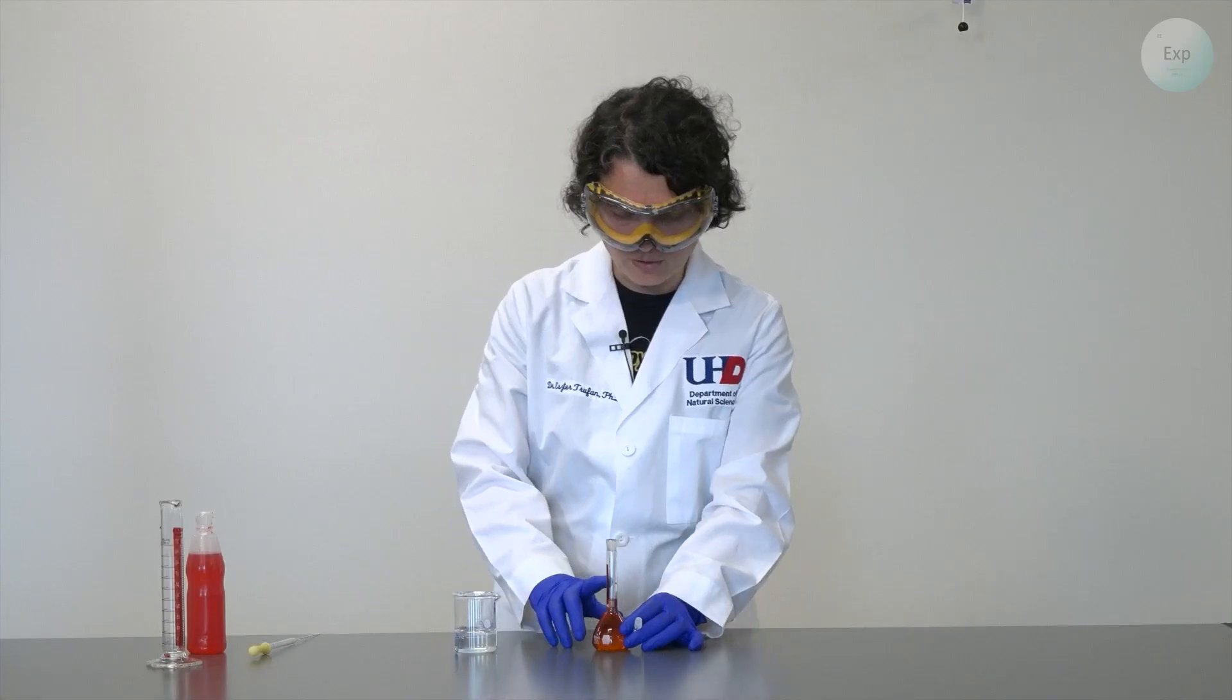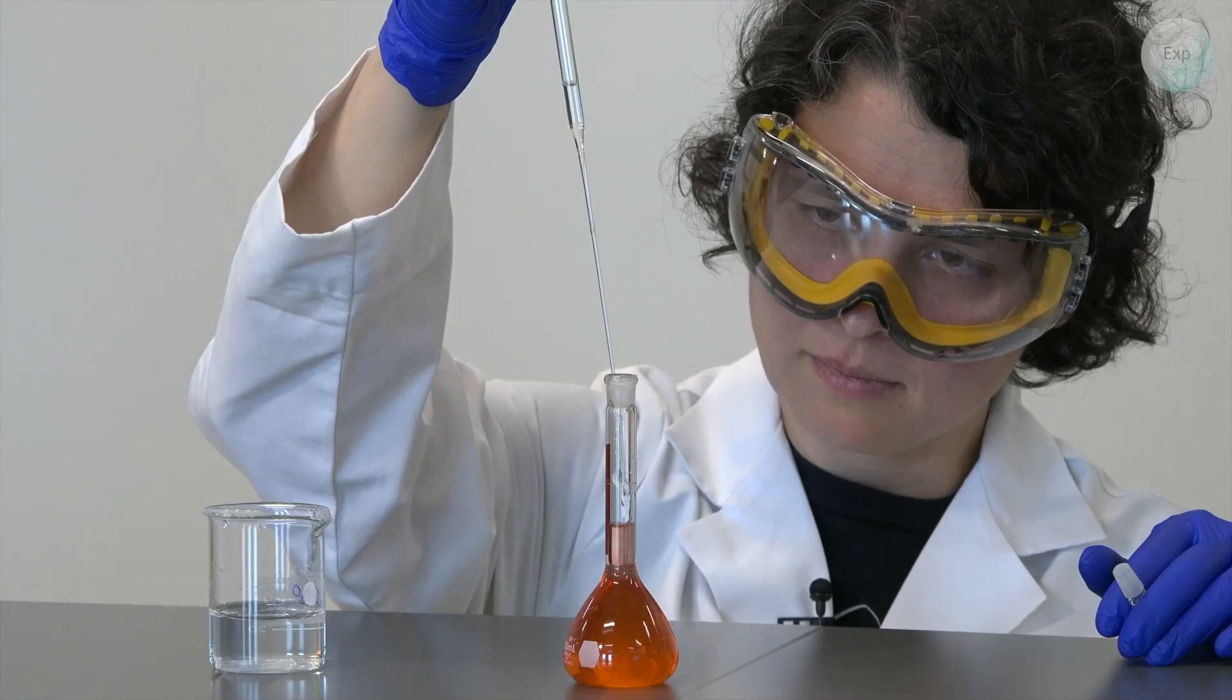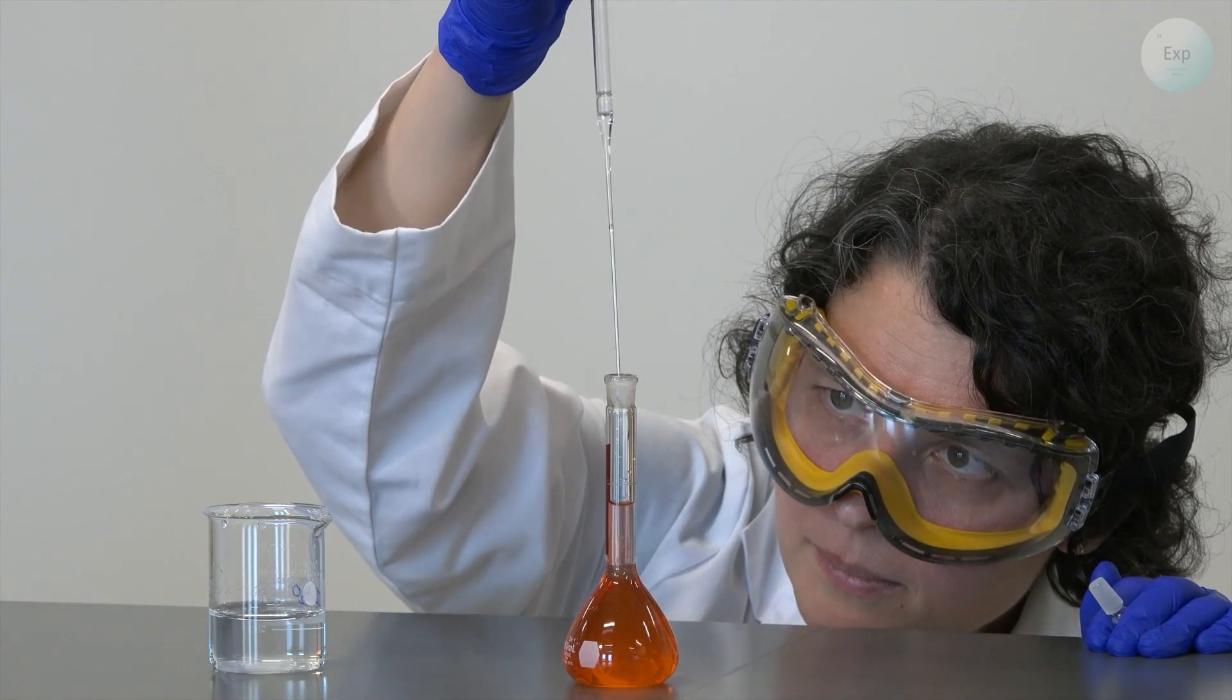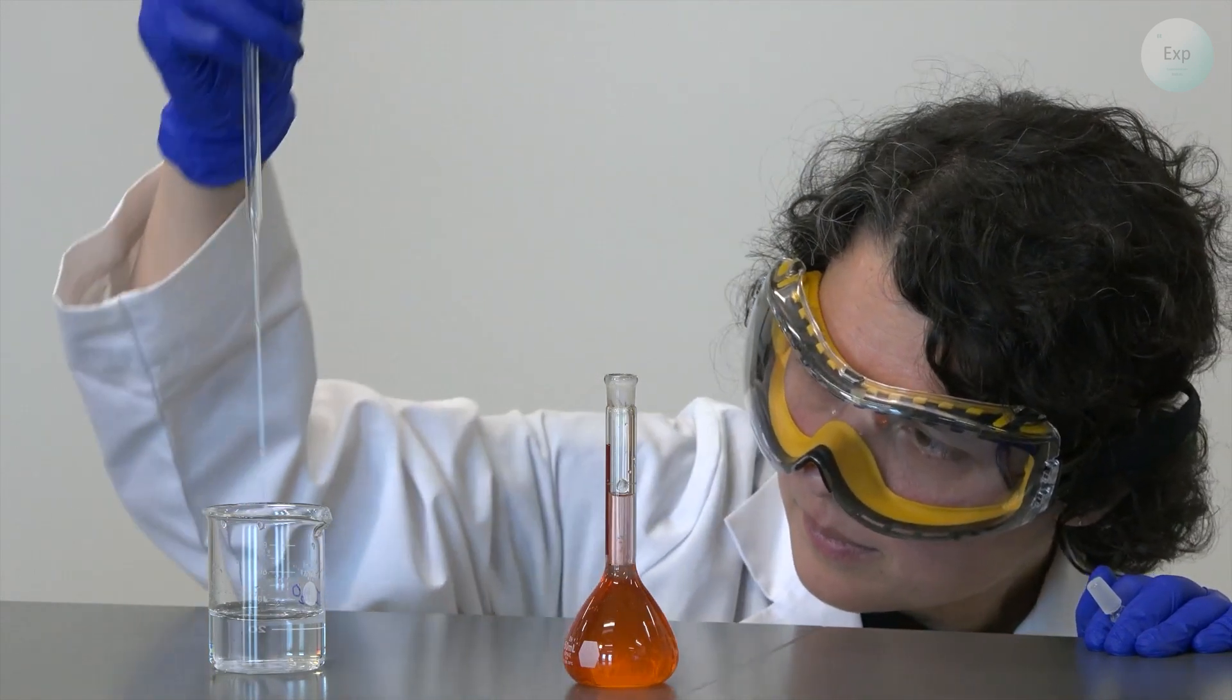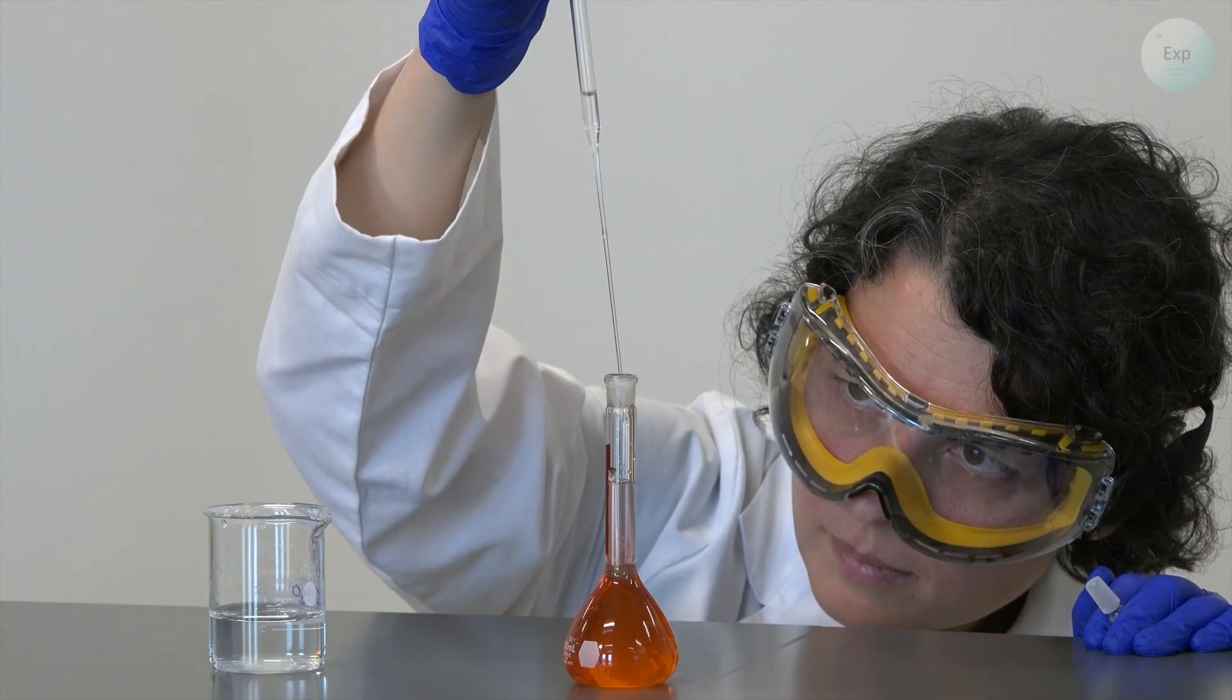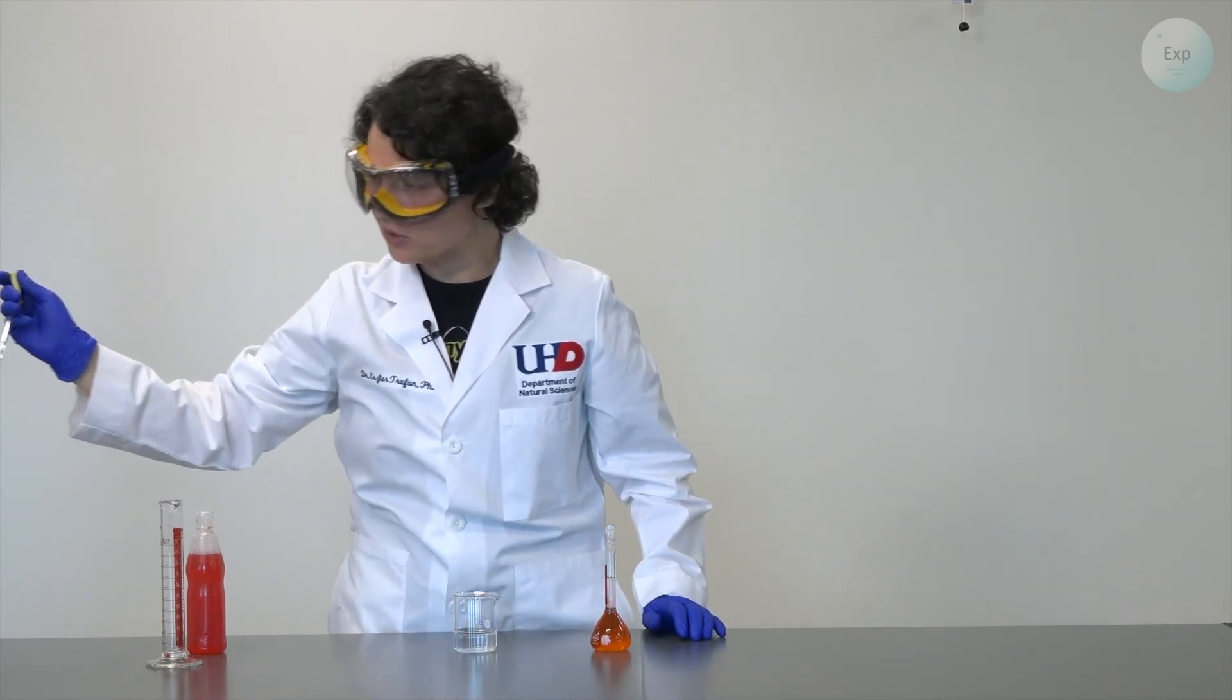And as we approach the mark on the volumetric flask we switch to our pipette. And then we get really close to it. And now we have exactly 50.0 milliliters of solution.